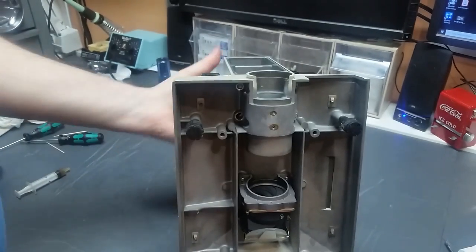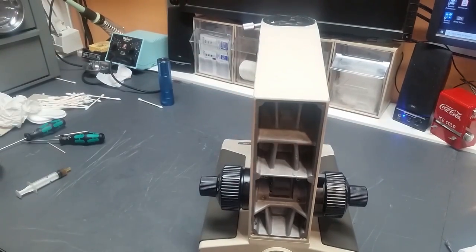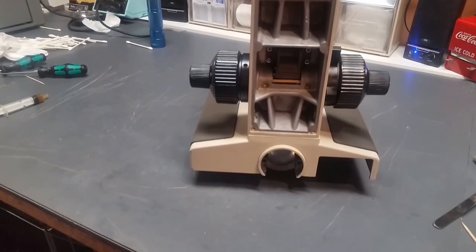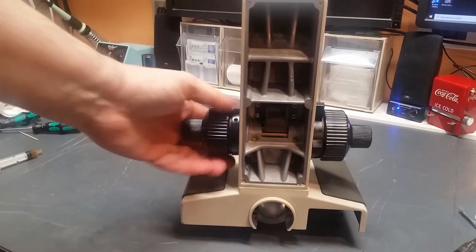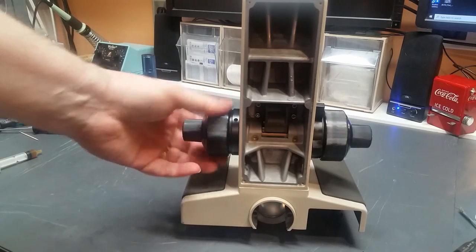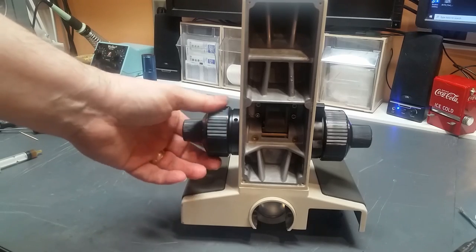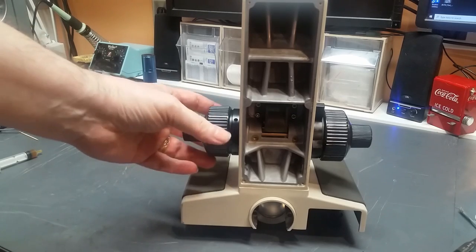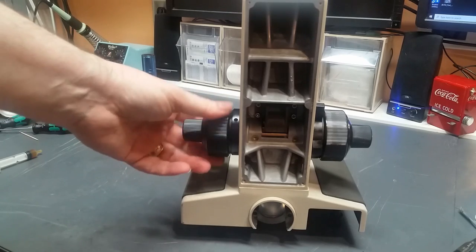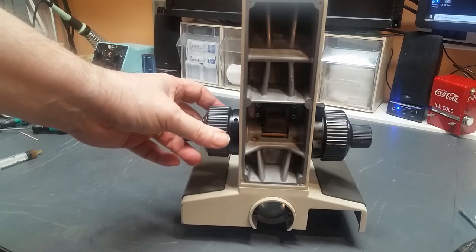And I'm going to set it back up in a normal position. Put the camera back down. And we're going to see how it works. There's a little bit of groan. So I'm going to go back and repeat that. When you hear that noise, if you can hear it, that's because the gears aren't meshing properly. So I'm going to go repeat that alignment and see if I can do better.